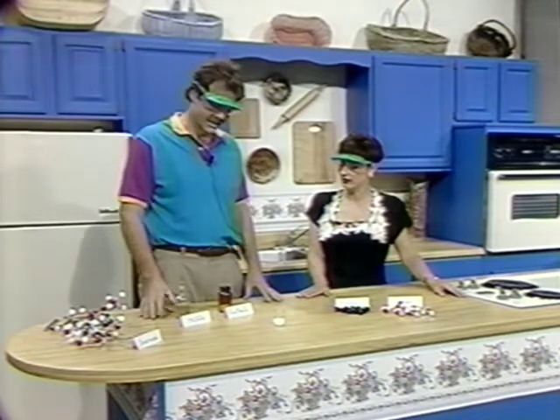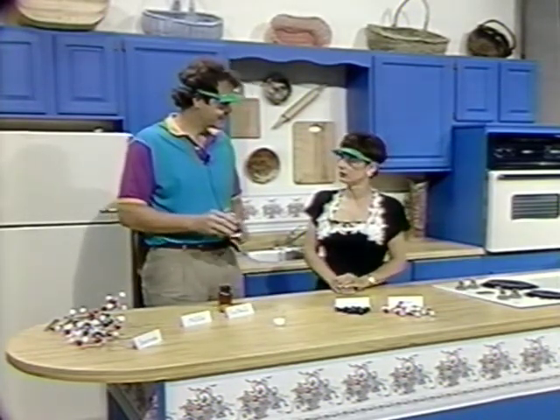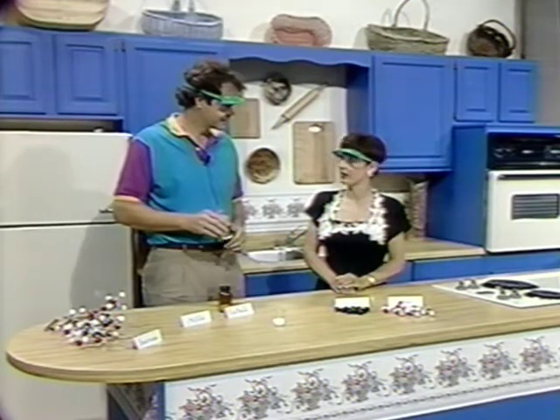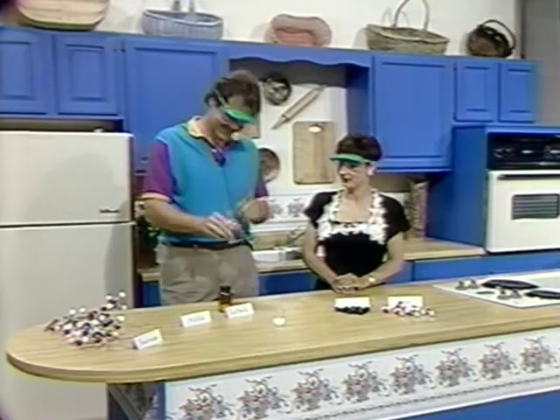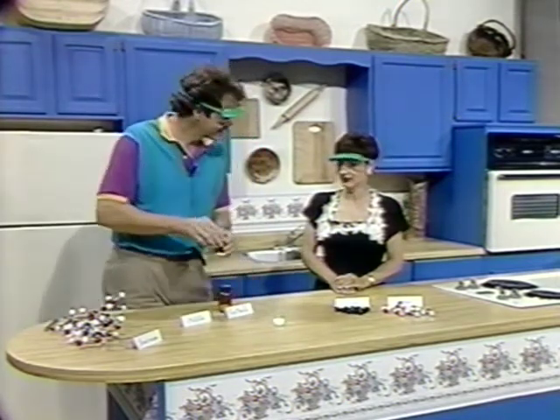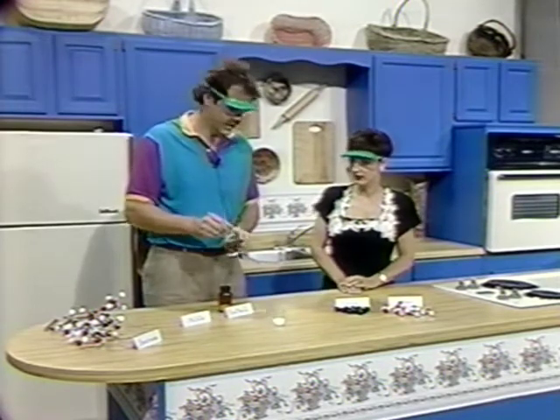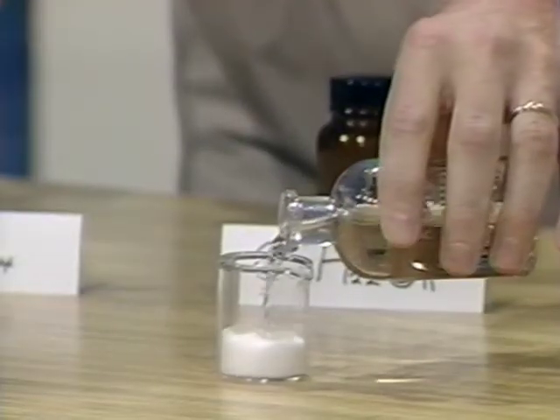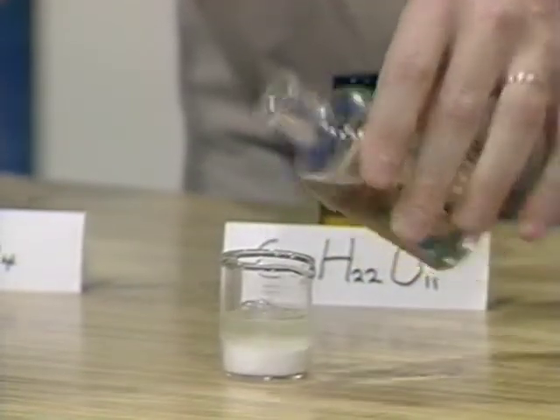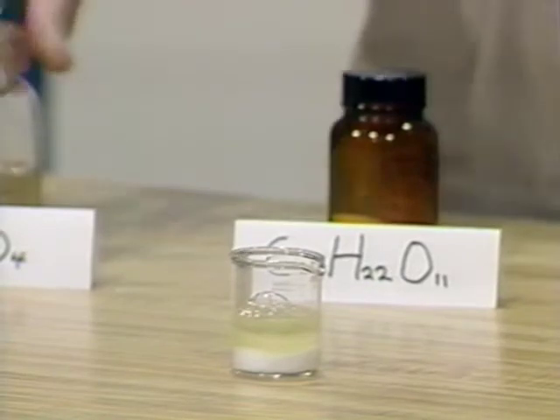All right. Now, this is sulfuric acid. Have you ever heard of sulfuric acid? I think so. What is it? It's battery acid. That's right, that's the acid that's in our car batteries, so you don't want to fool around with that. This is a corrosive material. We're going to pour some sulfuric acid onto our sugar and just let that sit there a while, and we should notice something begin to happen.